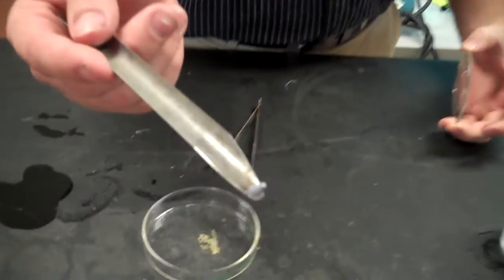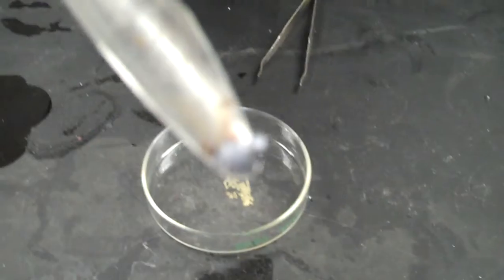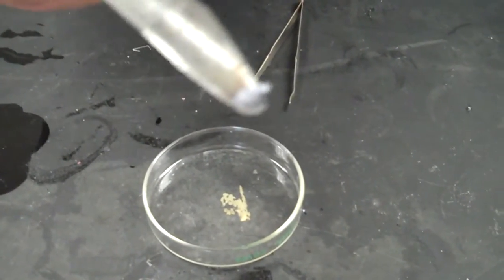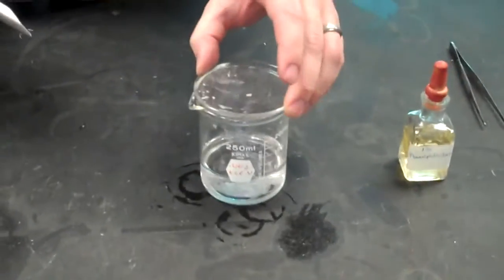Before I do that, I just want to show you. Potassium has a little bit of a silvery, grayish color, and it's a little shiny, a little bit shinier than sodium. So I'm going to place this now in the water, and you can see that it's letting off a purple flame. It's reacted, and it was a very small piece, so it's not a very long reaction, but it reacted even a little bit more violently than sodium.